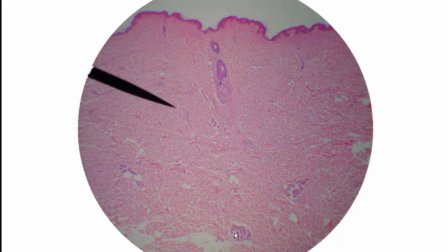There is also an eccrine sweat gland, and up here is an eccrine sweat gland. Lastly, hard to see at this low magnification, but this is actually one of the muscles in here that creates goosebumps, arrector pili muscle or arrector muscle. So those are some of the accessory structures here, but the major thing for this level of magnification, at least for my students, is to know those three major layers: epidermis, dermis, and then down here where the adipose tissue is, we've got hypodermis.